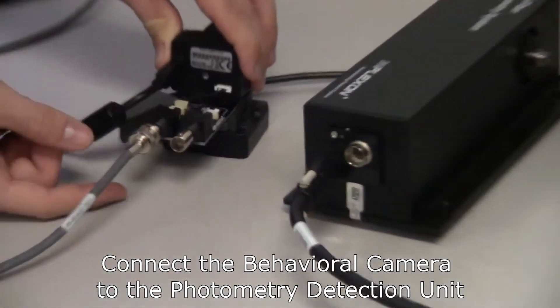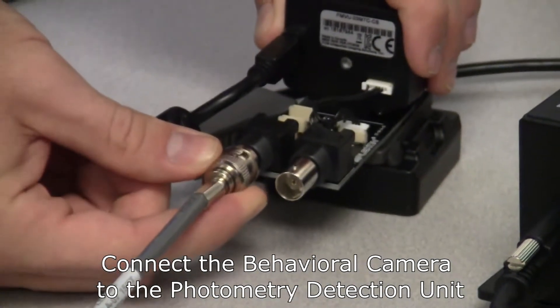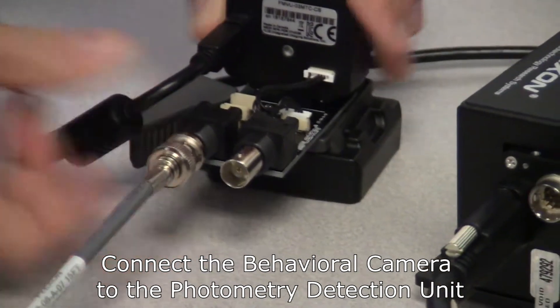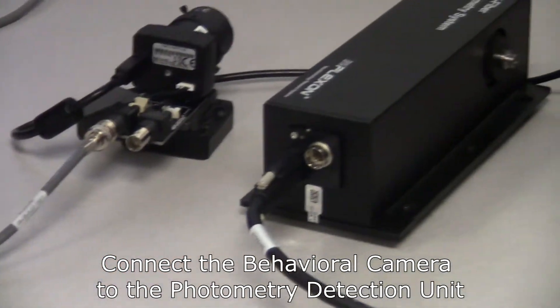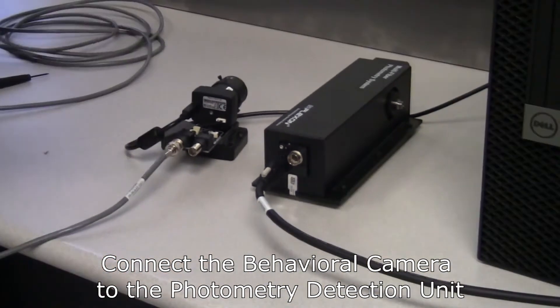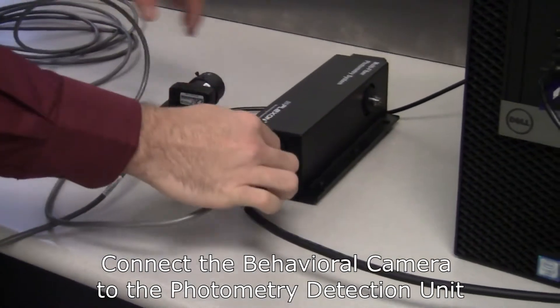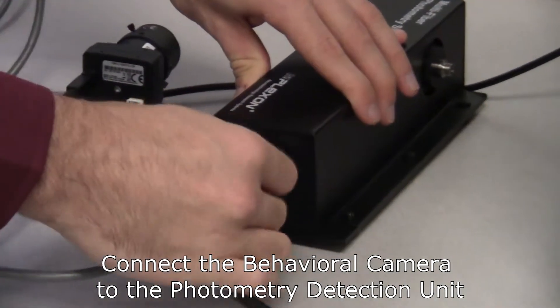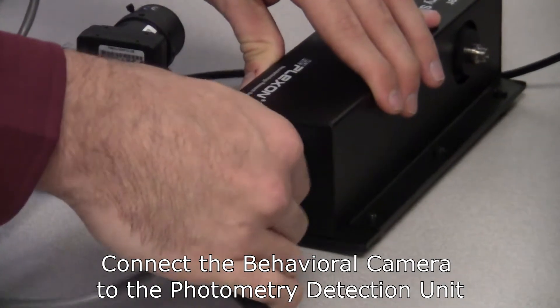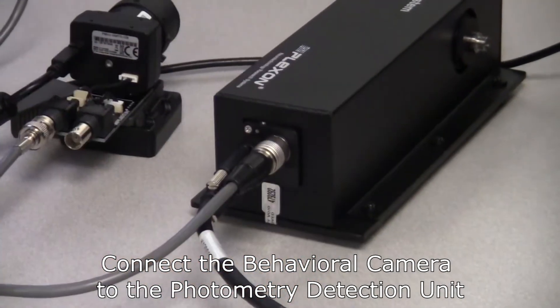Next, we will be connecting the behavioral camera to the photometry detection unit using the camera trigger cable. When connecting the trigger cable to the camera, make sure you twist to lock the cable. Ensure that the cable is securely connected to the photometry detection unit.